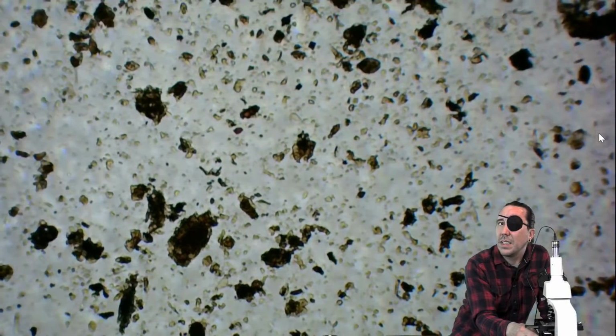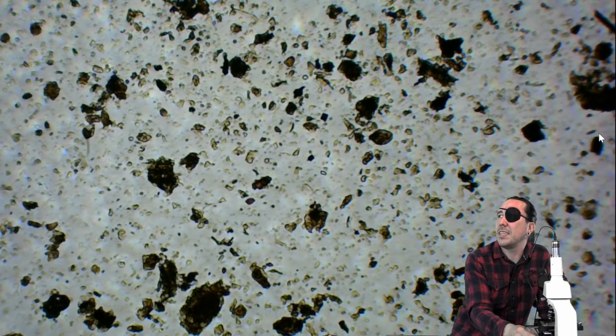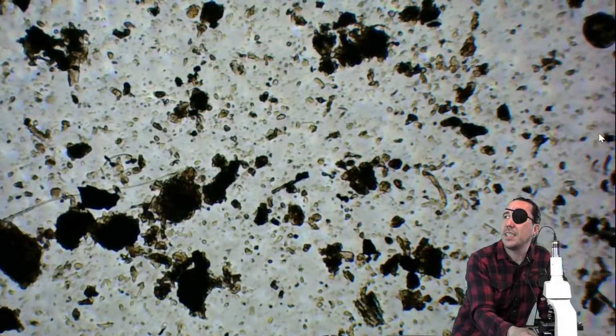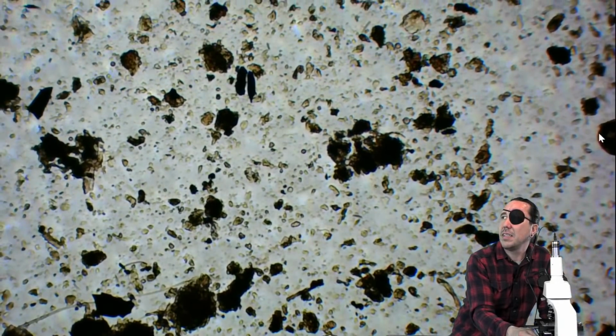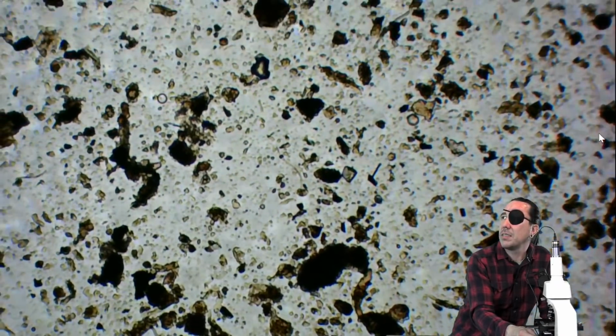If Dan says something, you might want to repeat it because then it won't be in the recording. Okay, I'm speaking to Dan at the same time here to see if he's got anything. He's viewing a microscope at the same time to see if he can find anything that's neat to look at, or something that we can use to identify organisms.